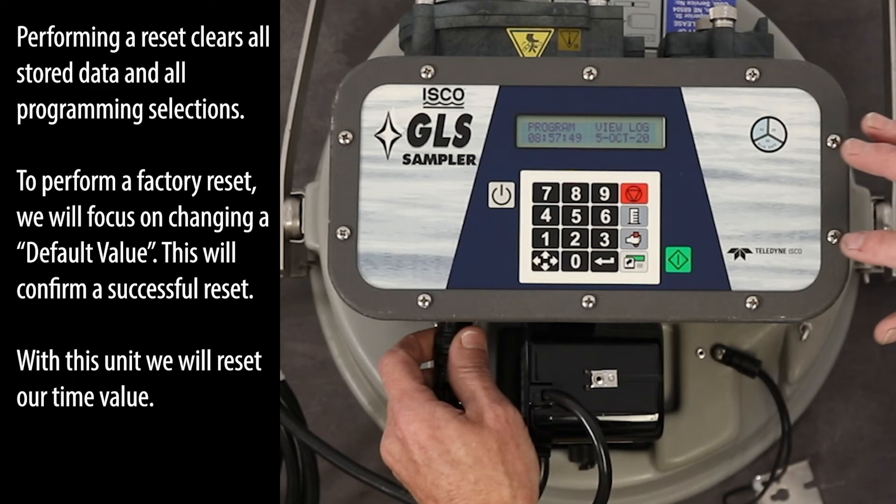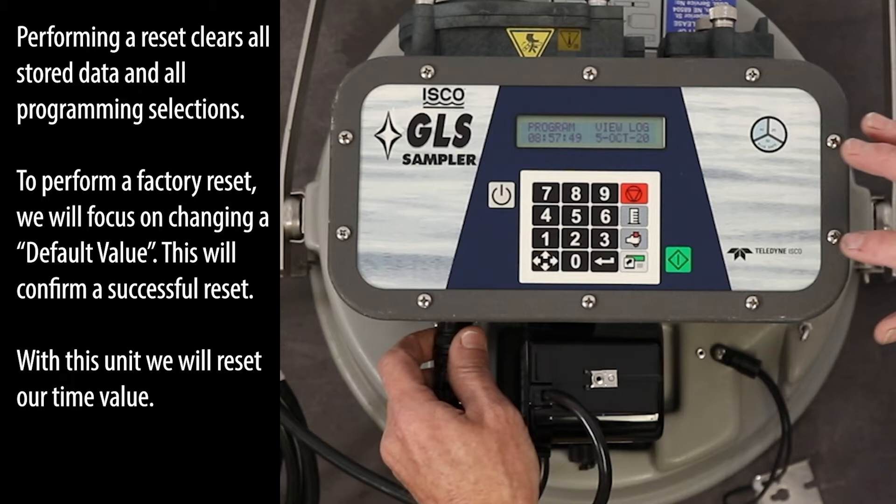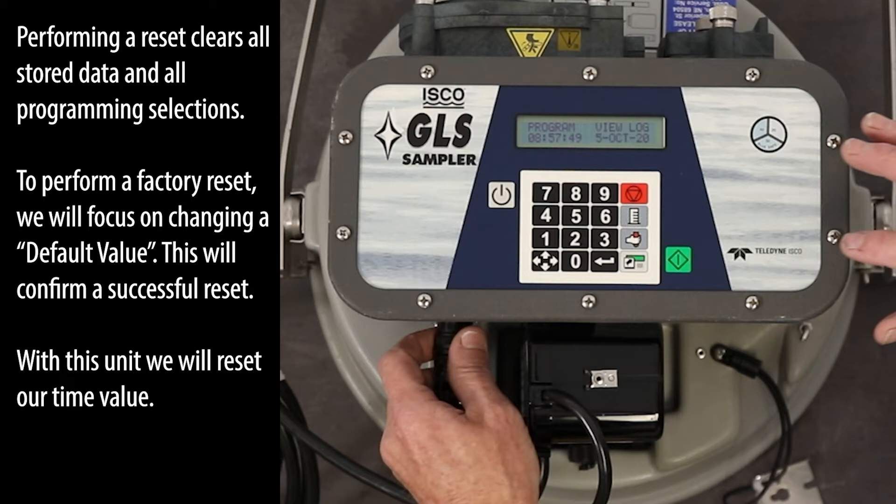Performing a reset clears all stored data and all programming selections. To perform a factory reset, we will focus on changing a default value — this will confirm a successful reset. With this unit, we will reset our time value.